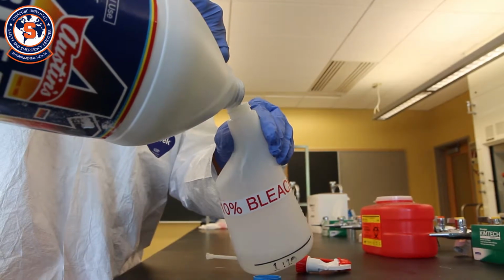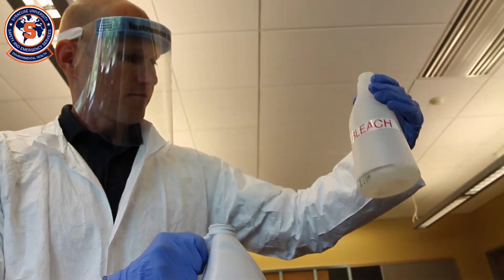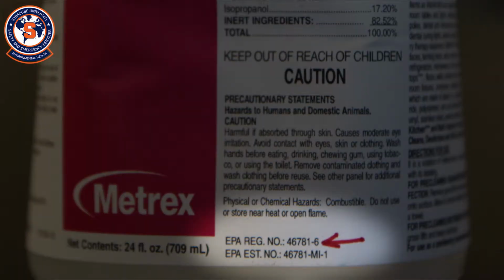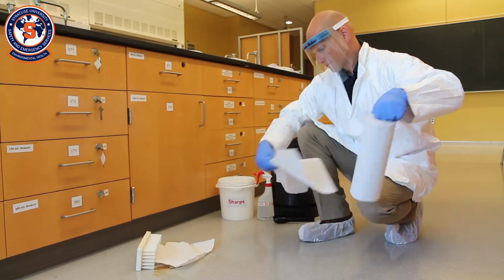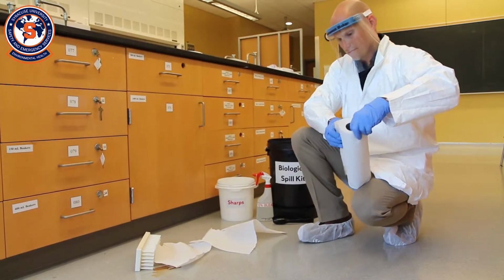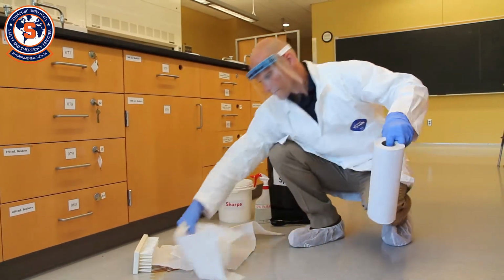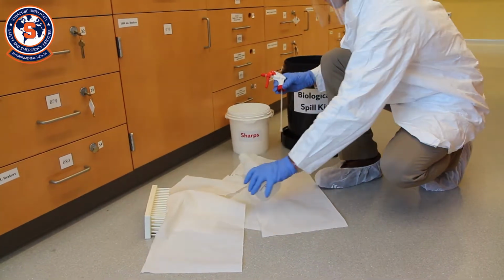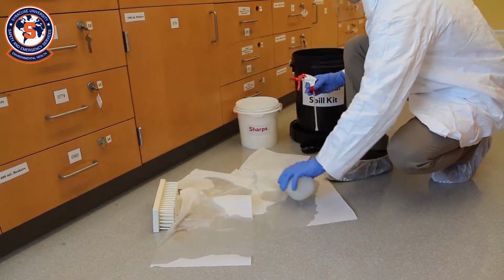If you are using a ready-to-use disinfectant, be sure it provides the appropriate disinfection properties, and make sure the label indicates that the product is an EPA-registered disinfectant. When ready, cautiously approach the spill. Look for areas that might be contaminated, and cover the area with paper towels or other absorbent material. Pour the disinfectant slowly, starting at the outer edge of the spill and moving toward the center.